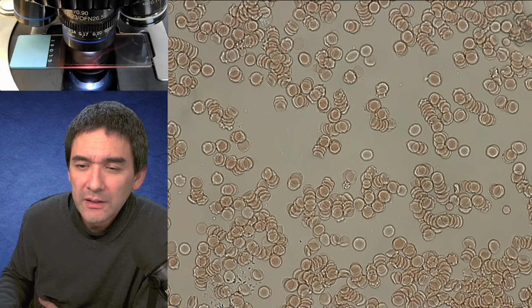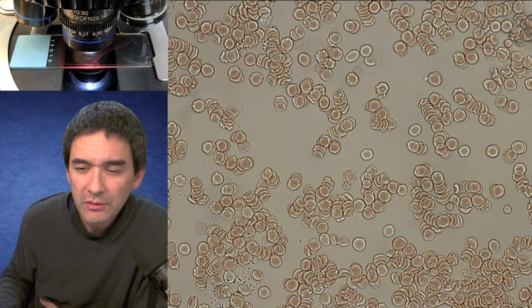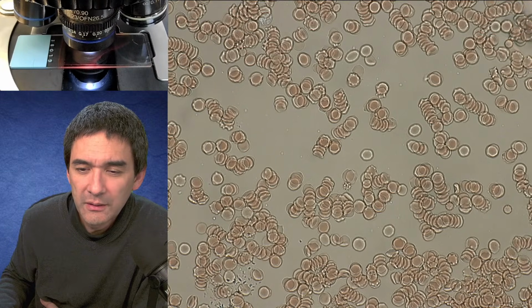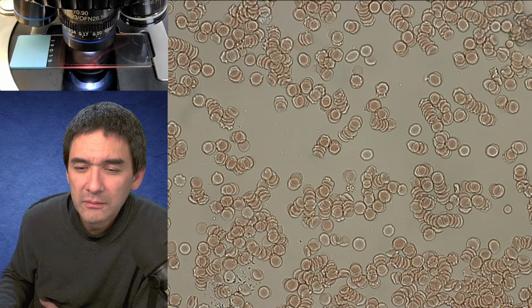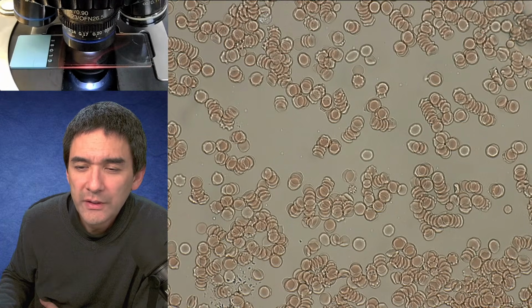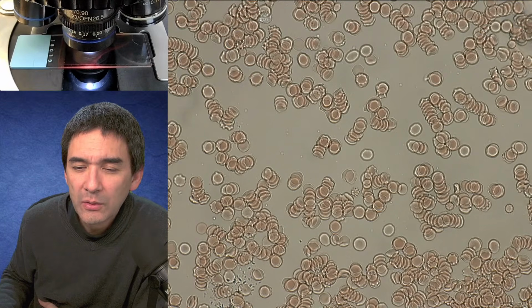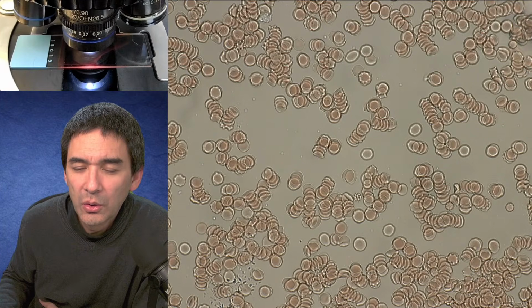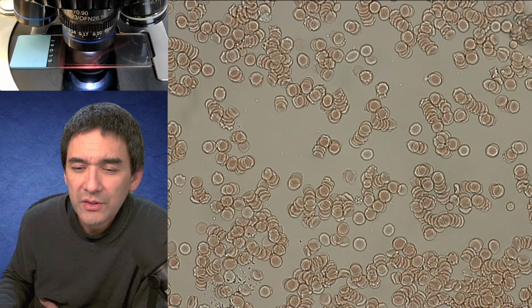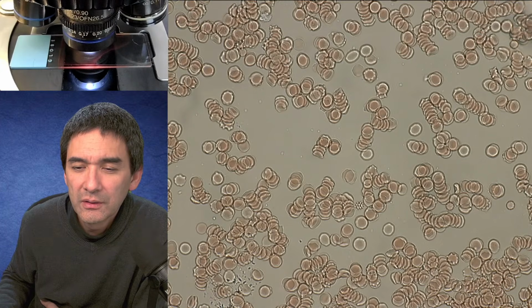Yeah. Can you, okay, I guess it's also for me a salt crystals video. Sure. Okay, fine. I'll do that. Yeah. Again. Packaging. I'm reading: the blue plastic holding the pin should be seated all the way back as far as it will go. Then you start with 0. Okay.